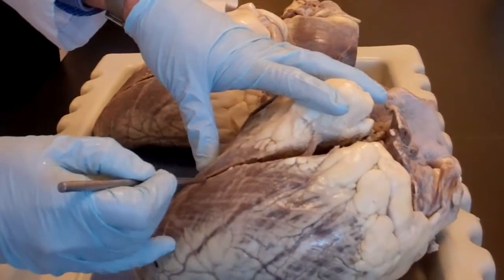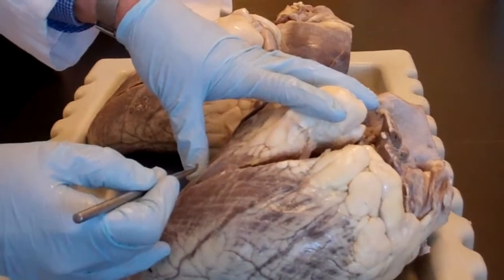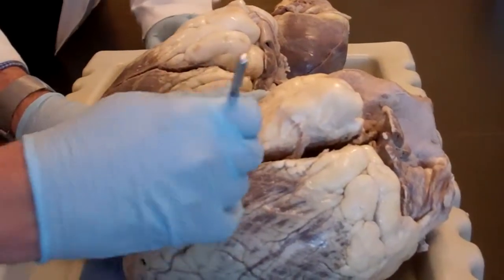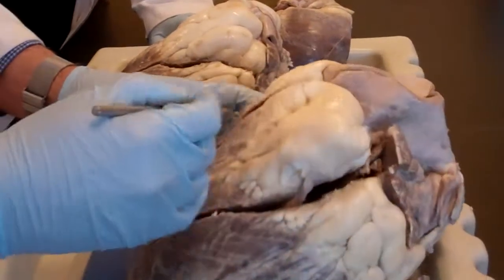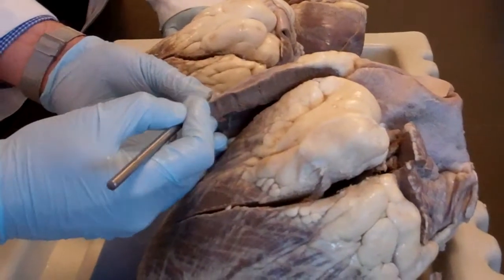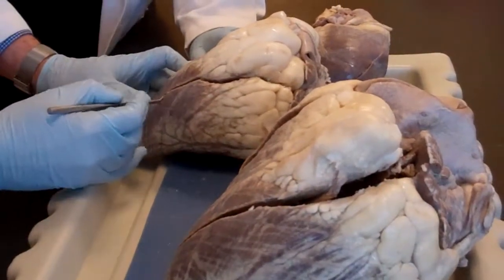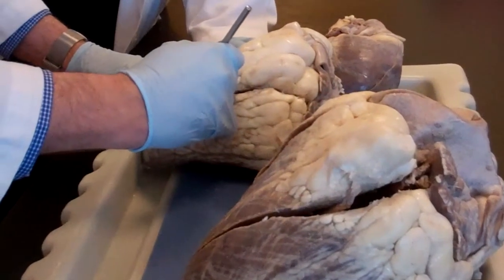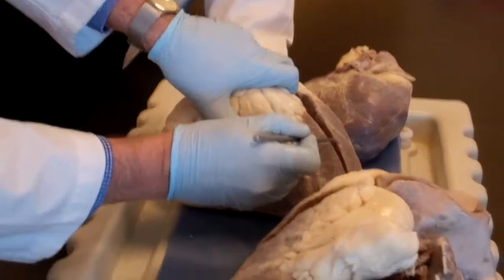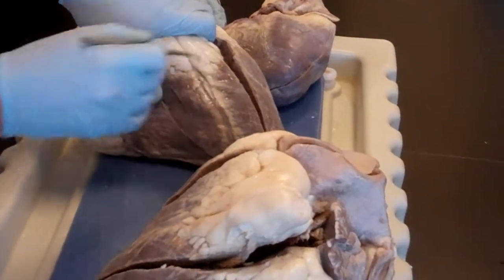And the last one, obviously, is the epicardium, which technically is the visceral pericardium. So this is this layer right there. It's a very thin layer that you can barely get off. Some of my students took it off, and they wanted to show, hey, here is the epicardium, which is okay. It's exactly what you're supposed to see. See how thin this is? Here is the epicardium, that white thingy on top of the muscles.